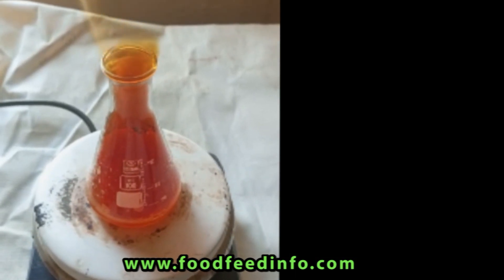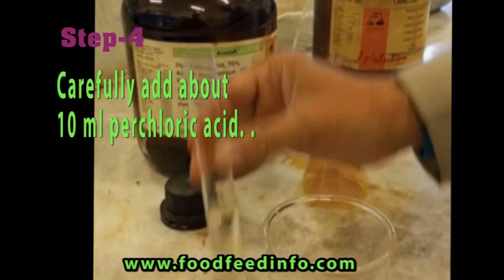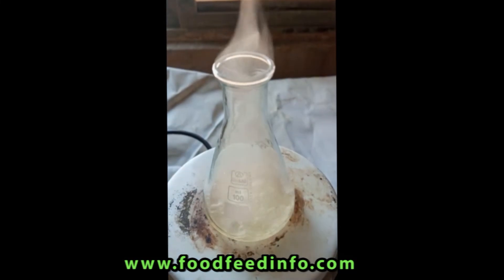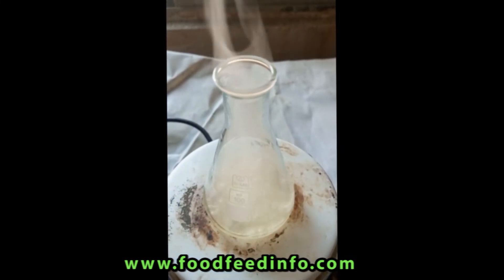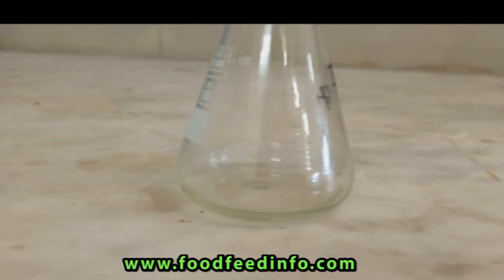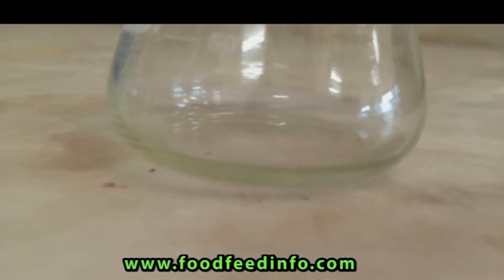Carefully add about 10 ml of perchloric acid. Heat at low temperature for about 10 minutes, then at high temperature until about 3 ml of clear colorless solution is left. Always be careful — do not heat to dryness as it will destroy certain minerals.